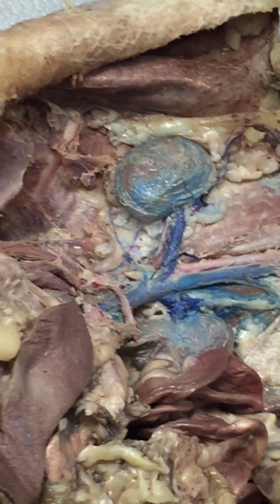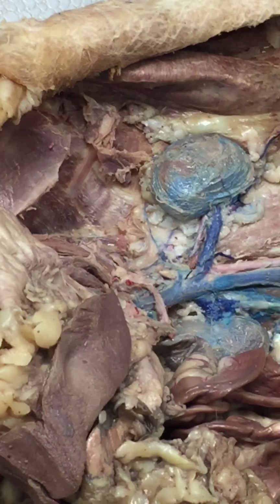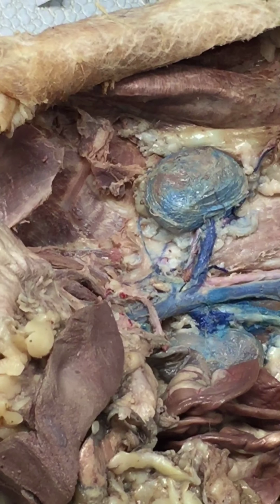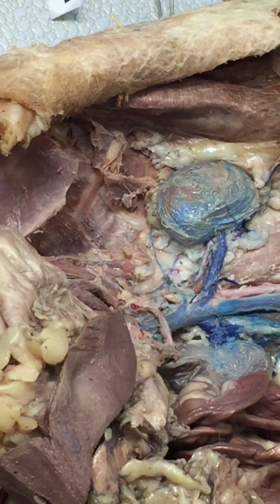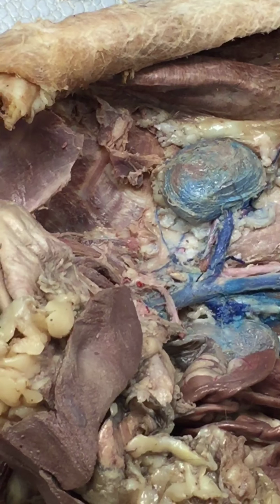So, difference between the veins and arteries is, as far as we need to know at least, you only need to know 2 branches coming off that inferior vena cava, the adrenolumbars and the renals, okay?